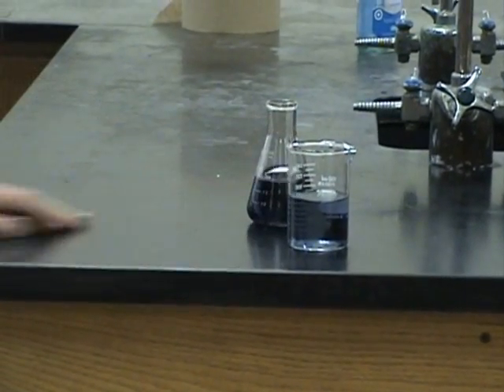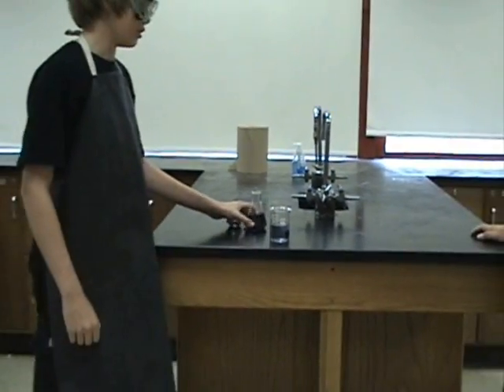There, now that's done. Should we smell it or waft it? I heard it works only if you smell it directly. Let's smell it directly.